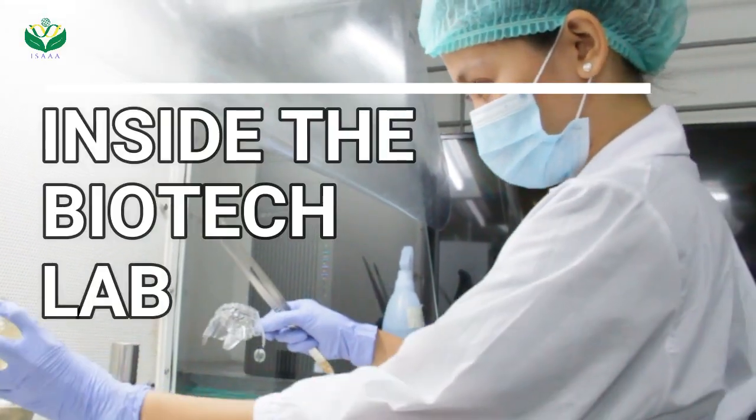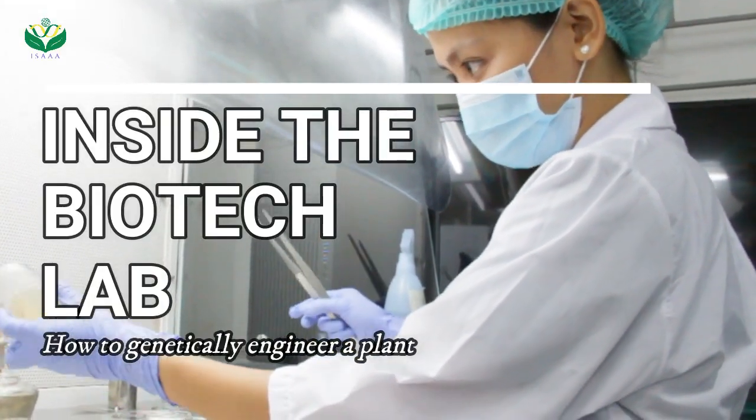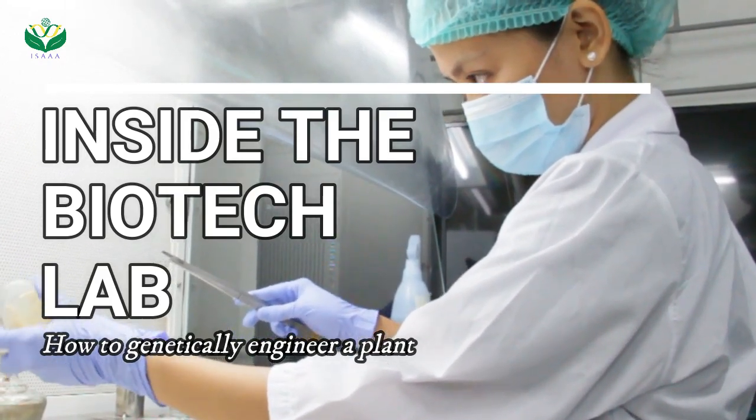Inside the Biotech Lab: how to genetically engineer a plant.